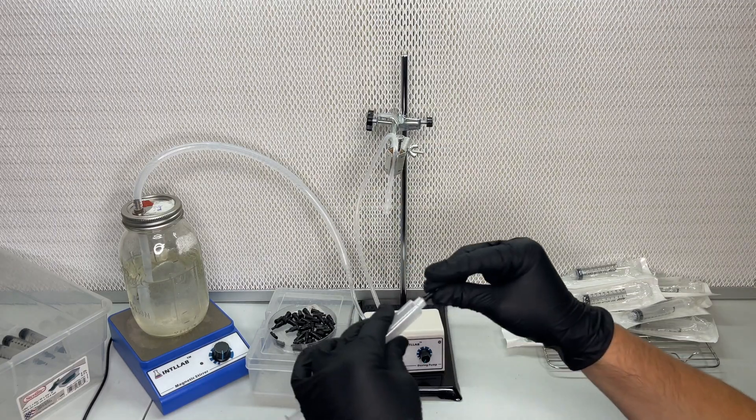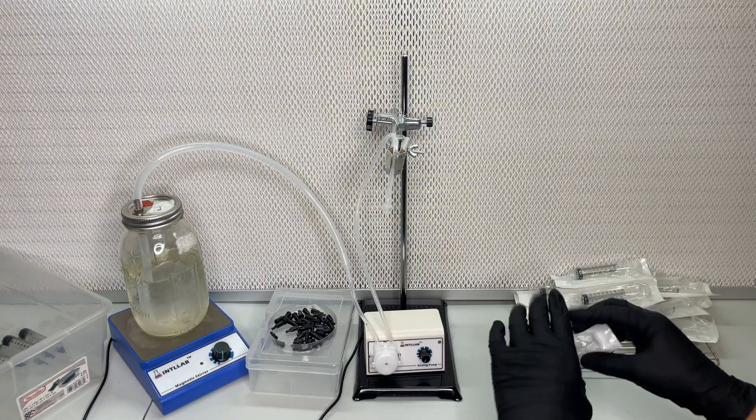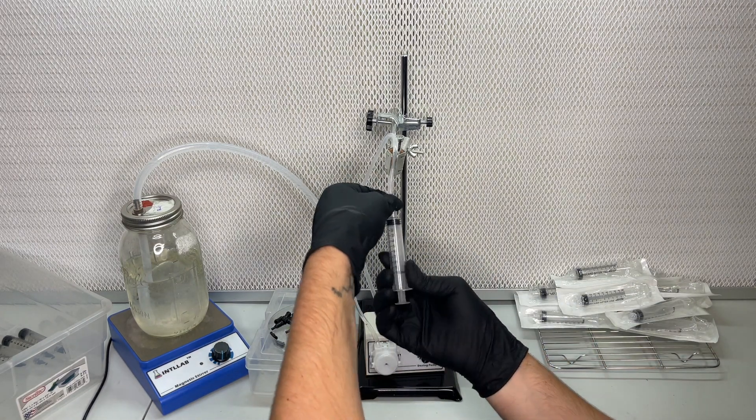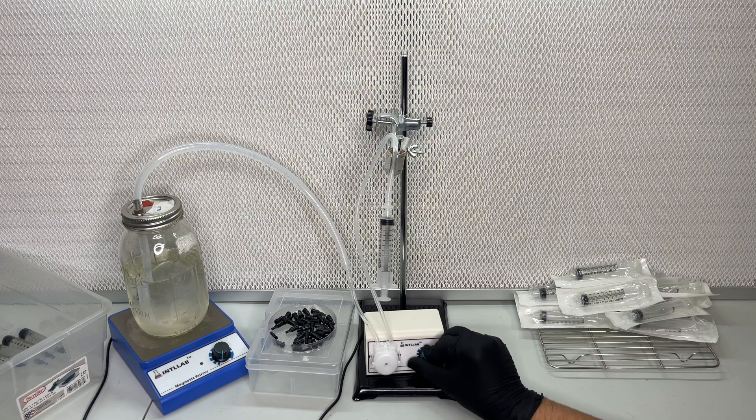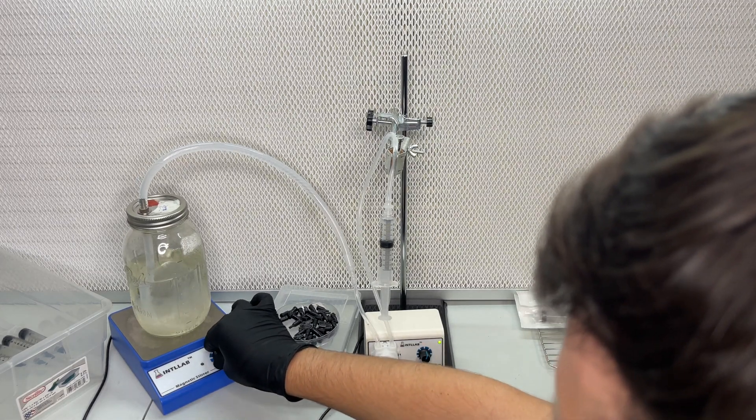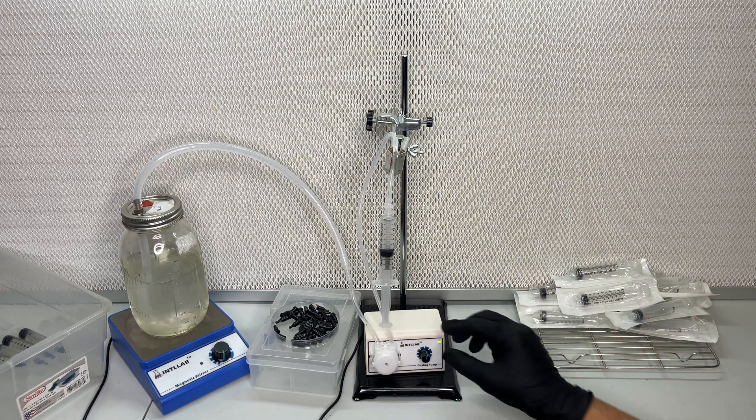If you're doing many jars of the same species you can change out the tube between jars, or you can sterilize different sets of tubes for different species. I was surprised and happy that the system worked exactly how I thought it would in my mind.